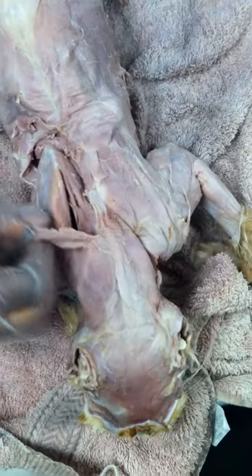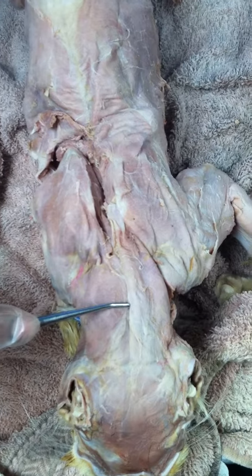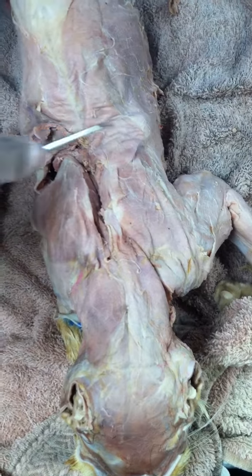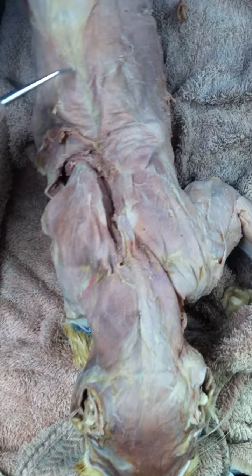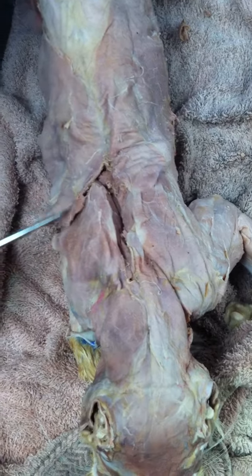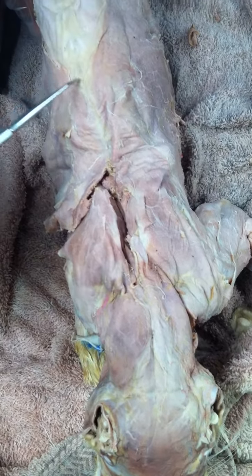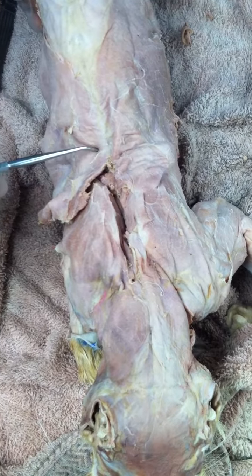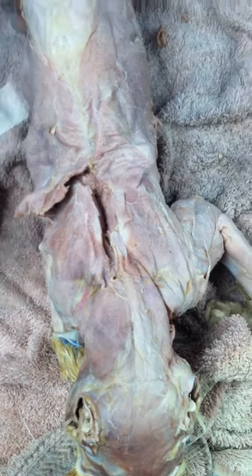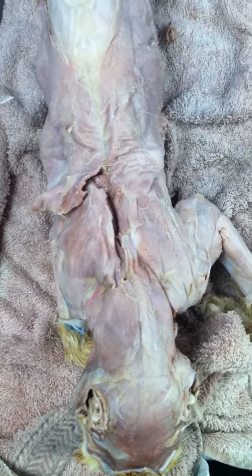Okay, and the other thing I forgot to mention, your trapezius is your clavotrapezius on the neck, acromiotrapezius on the scapula, and then you have the triangular shaped one here. This is all the way here. Okay, and that is your spinotrapezius. In human beings, that's one big muscle which you call the trapezius muscle.